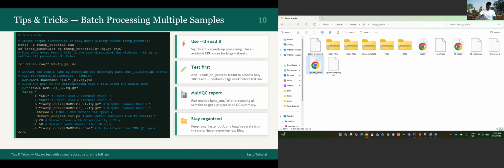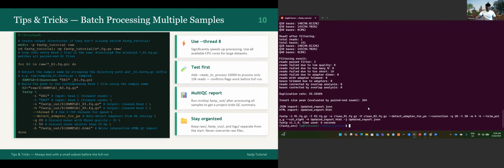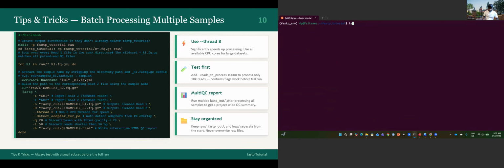Okay, this is another way you can do the same thing, but I will not teach you how to write this script. I already have it. I will just show you the script and close this tutorial, because when you are working, you can also use a script that does the job for you. Let me clear first. In this directory, you can see I have a script that is doing the same job.